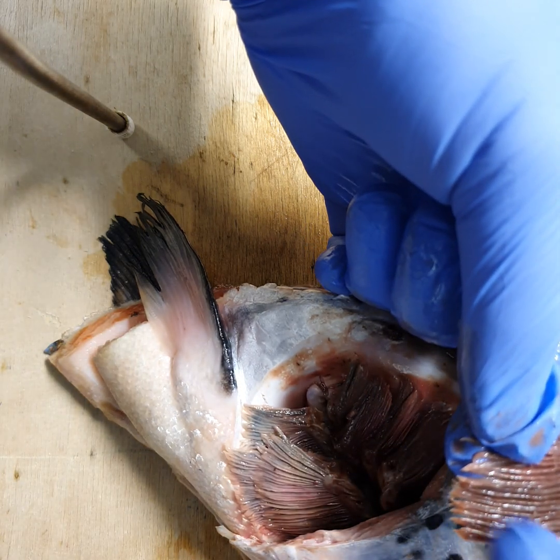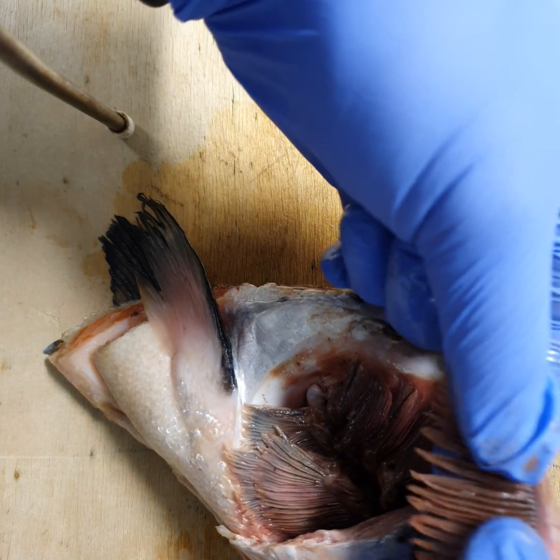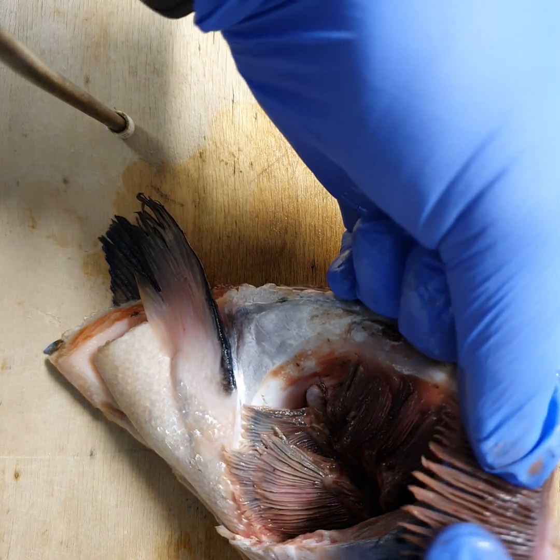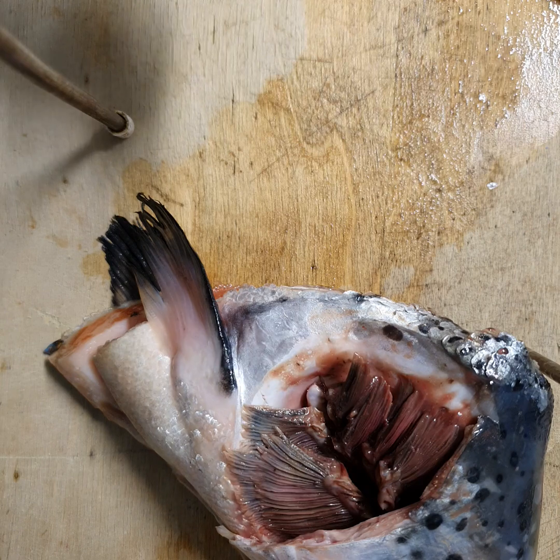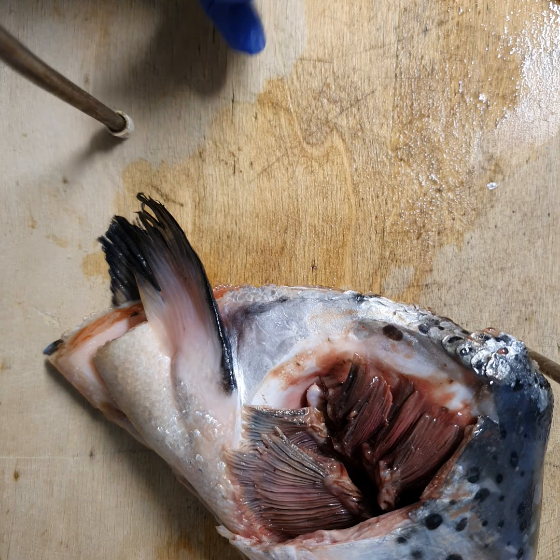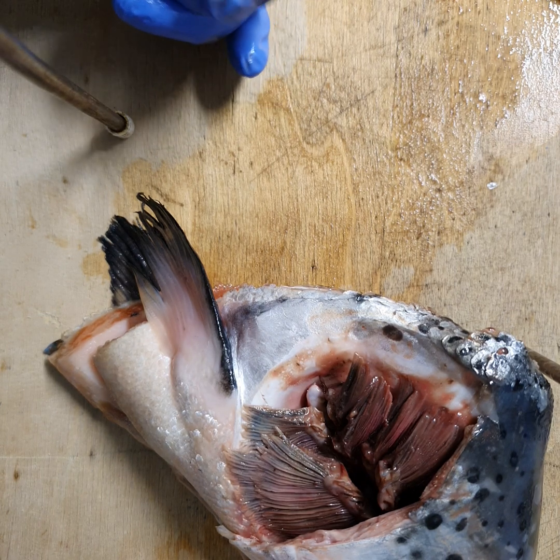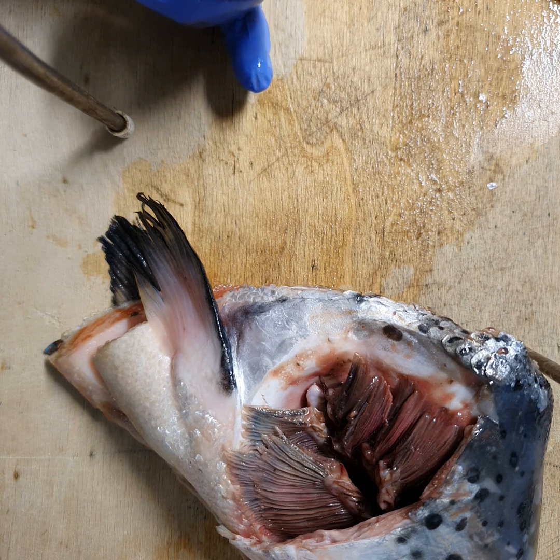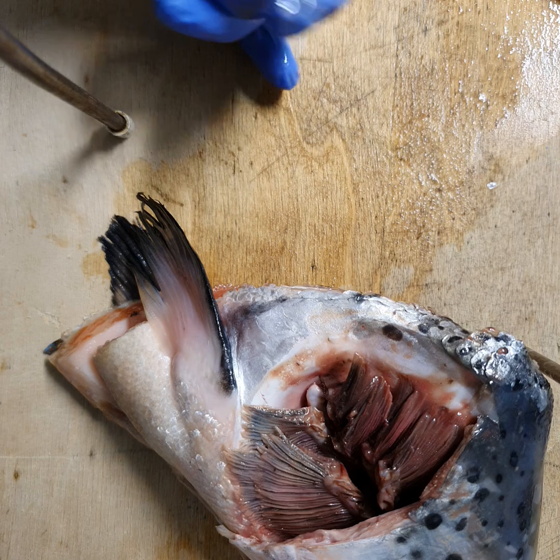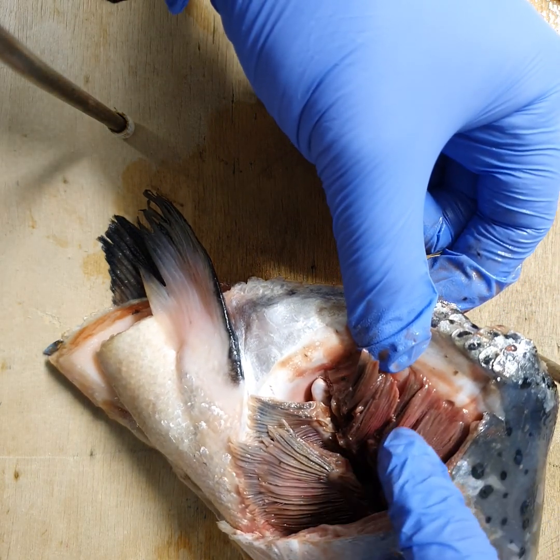One of the features of these filaments is that they overlap with each other. The benefit of that is it increases resistance when water is flowing through. By increasing resistance it slows down the rate at which water passes through, allowing more time for gaseous exchange to take place in the gills.